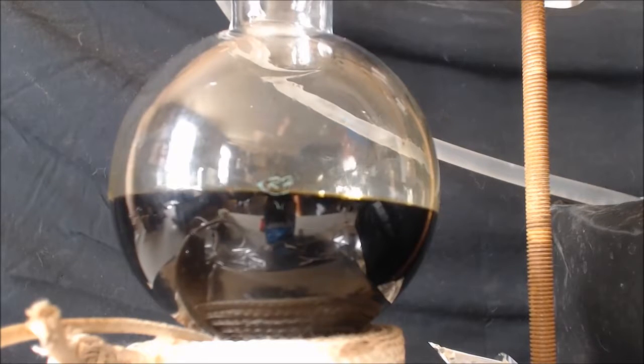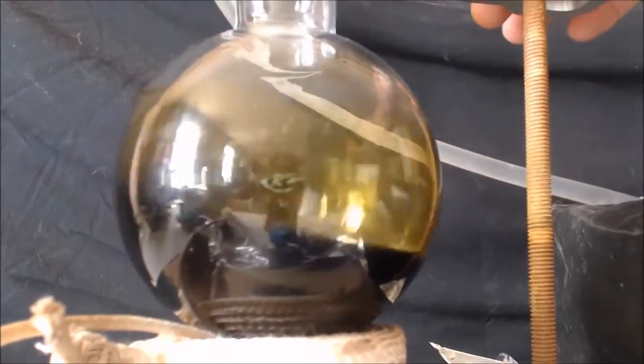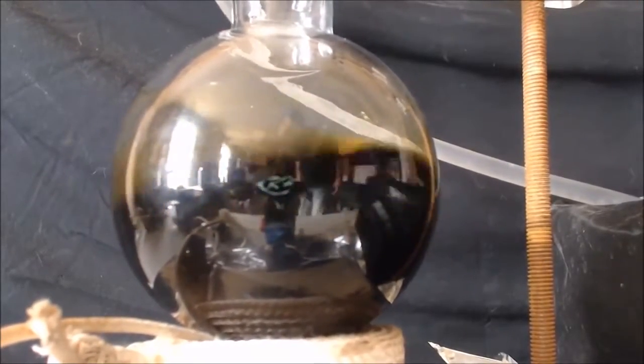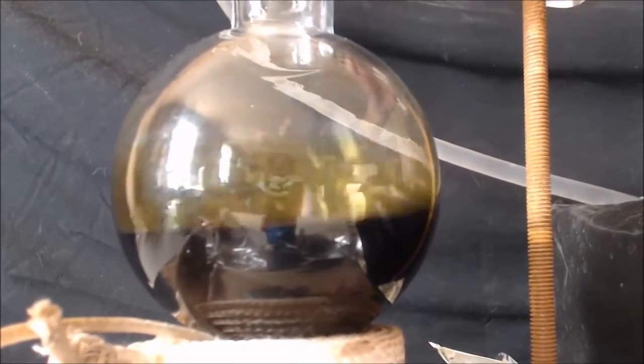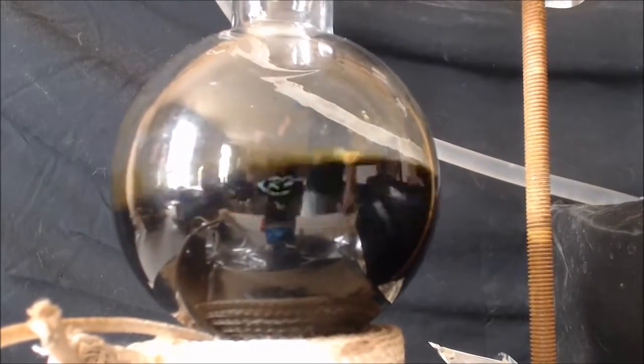Keep those gases in there. Formaldehyde wants to be a gas. You can't see it on camera but there is a slight gas inside there. I got to stir it manually because I got no stir bars, and I'm going to add some more.